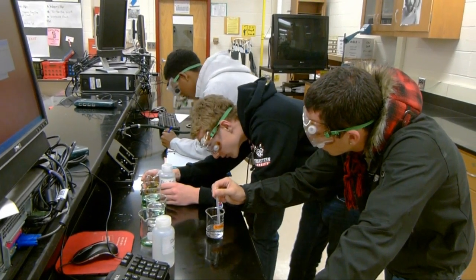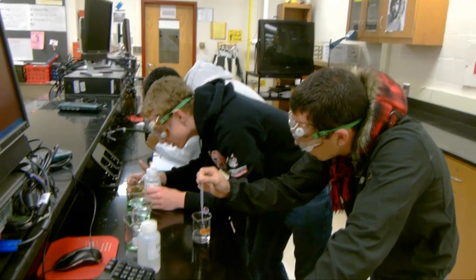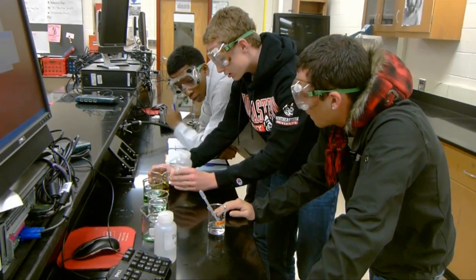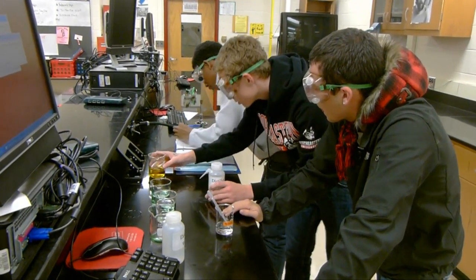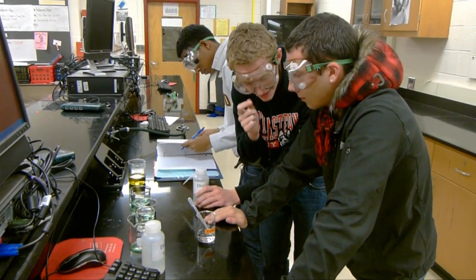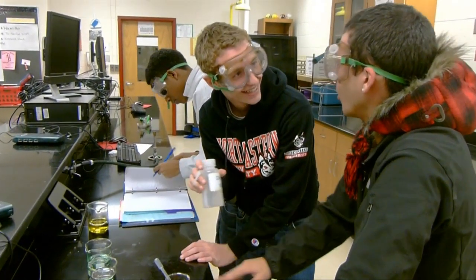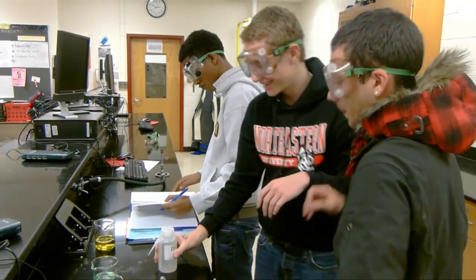I think I got it to the right pH level. You sure? Yeah. I mean, we might test it. Okay, all right, I'm going to record it. All right, cool. Yeah, just check it out. Yo, I bet I can get Adam to take his goggles off. And I'm going to squirt this in his face. Yeah, do it.